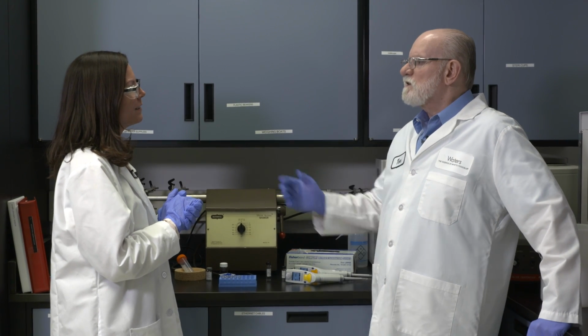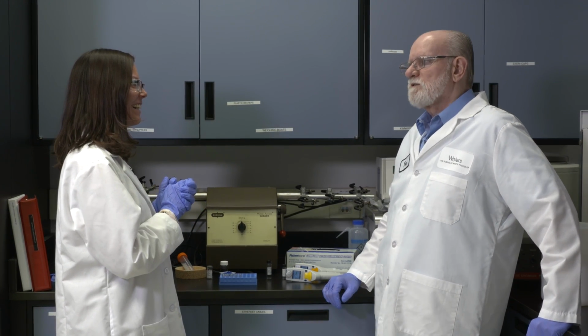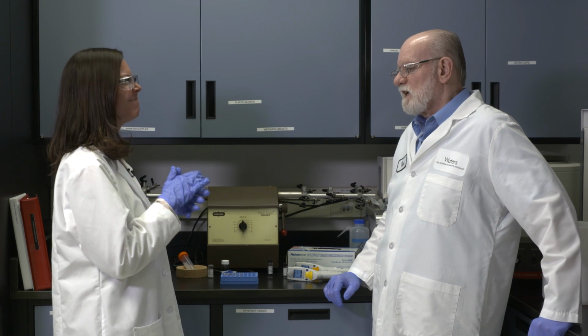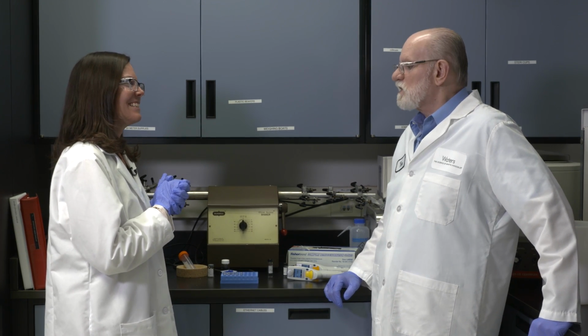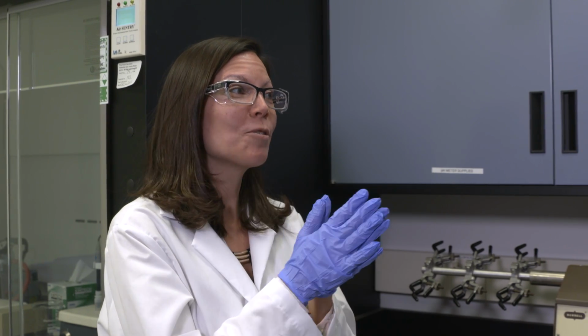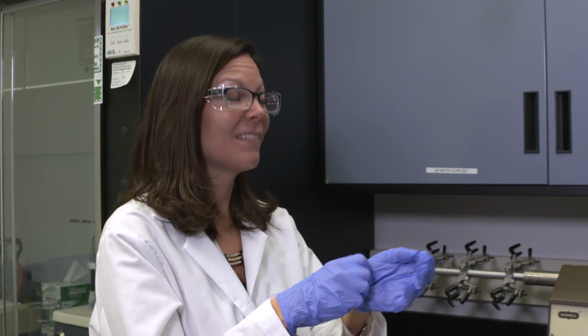Yes. Would you like to try to do one? I would love to try it. Okay, before you do that, you're going to have to change your gloves because you've been touching your hair, which is all full of amino acids. You touched your clothing, you've touched the lab bench, so your gloves are now completely coated with the amino acids that came from the environment. We'll have to clean you up a little. So sorry, Tom. Just like a true orchestra conductor, your eyes are everywhere to hold it all together. I'll change my gloves.